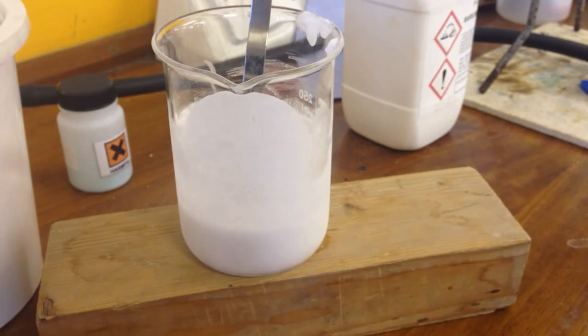And that is an endothermic reaction. It's taking energy in from its surroundings. And it's a very stinky endothermic reaction. Smells like a really old baby's nappy.